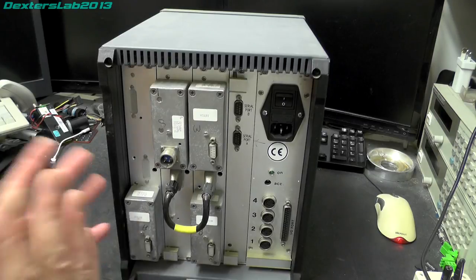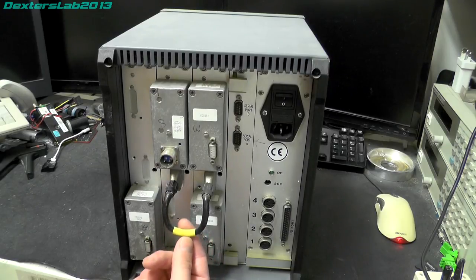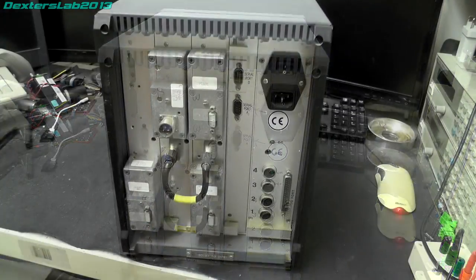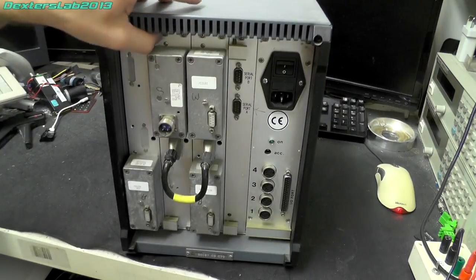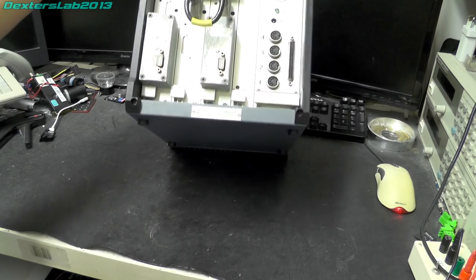So these are obviously, as I said, plug-in cards, depending on what you're actually doing. Interesting, these two are actually connected together as well by this little loop-through cable. Down on the bottom here, we've got a serial number plate, 50287-03079, made in France. Not very often you see things made in France, so shout out to all my French viewers. And of course, we have nothing on the bottom, apart from some feet, and we've got a rattle.